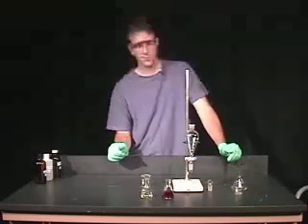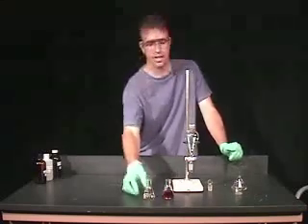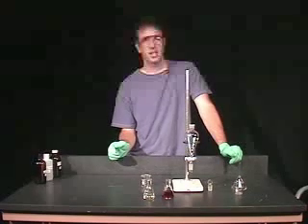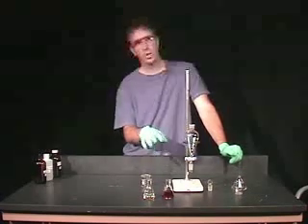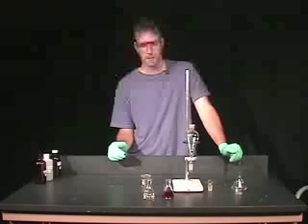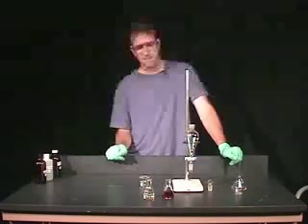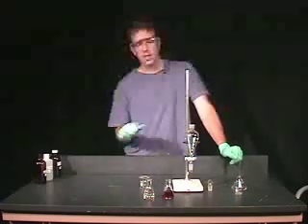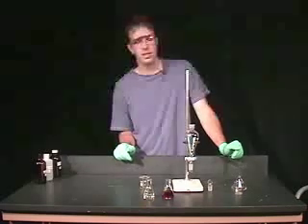As you can see, some of the color was transferred to the ethyl acetate layer. Typically in an extraction like this, you're going to do two or three extractions — you'll simply have to follow your procedure, which is given to you in the lab. I'm going to repeat this procedure using dichloromethane as our solvent.